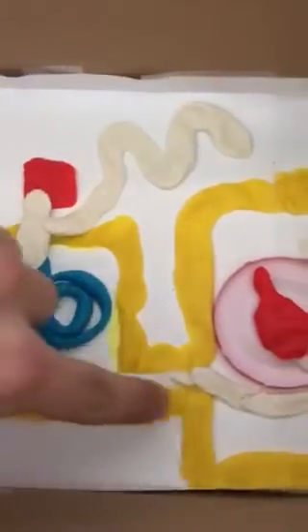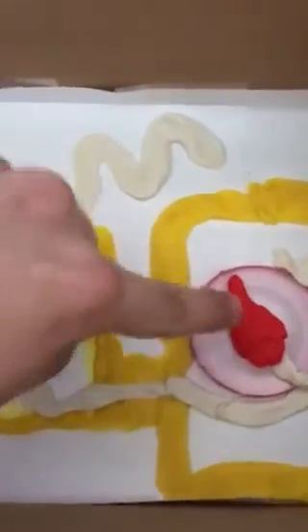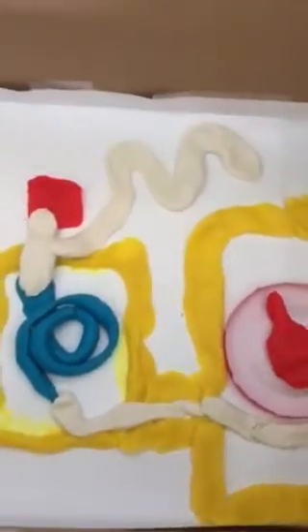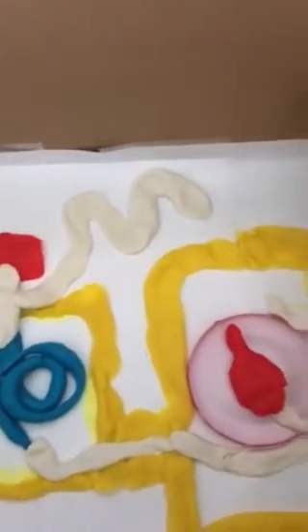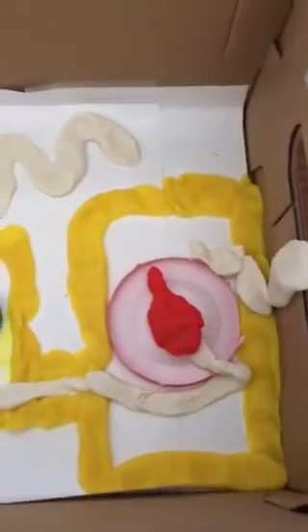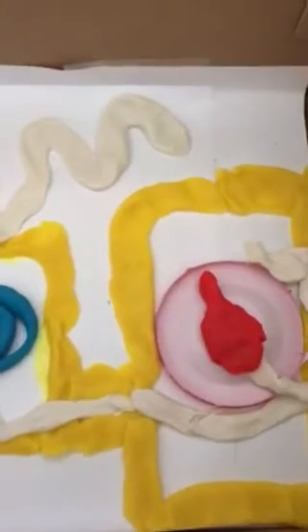Moving on to look at our detector, we leave the column and we move into this other part here, our detector. In the red here, we have a flame ionization detector. So this will burn our compound when it comes out of our column, and it will produce ions that will hit a detector plate, this part right here. And when it hits the detector plate, it will send a signal through to our computer over here, and that signal records a certain intensity and area based on how many ions hit the detector plate.